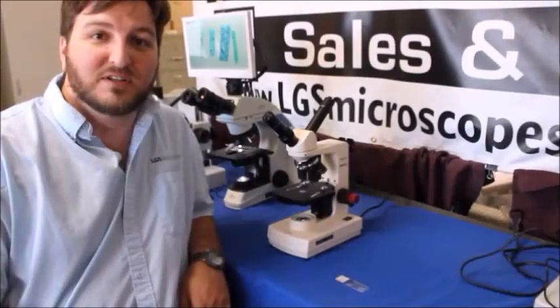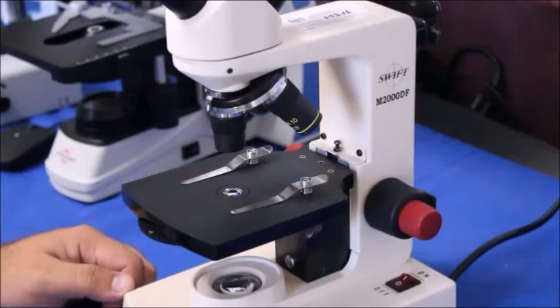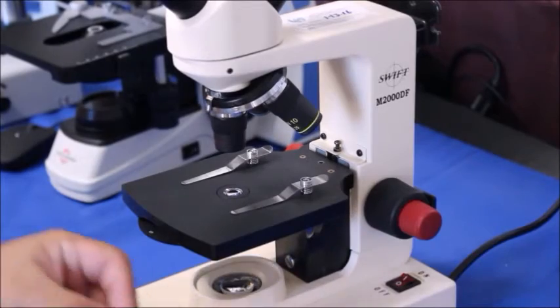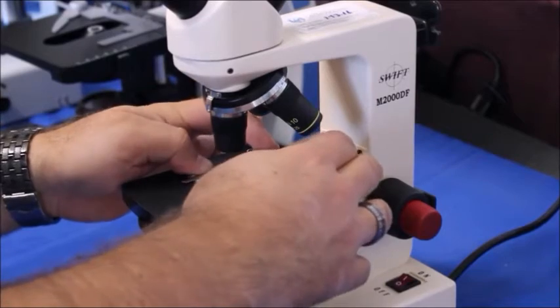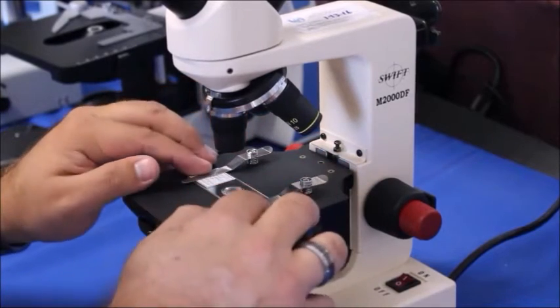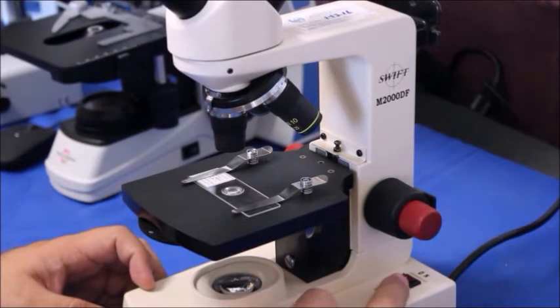Welcome to LGS Microscopes. My name is Paul. Today I'm going to show you how to use the microscope. We've got a sample here that's some green algae, so we're just going to take that, set it underneath these clips, and try to get your sample somewhat centered there. Turn on the light. This one has the light switch back here.